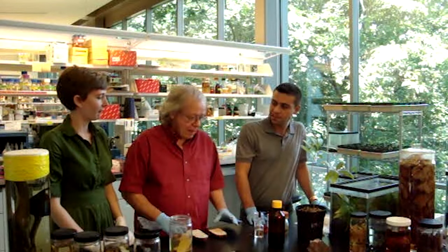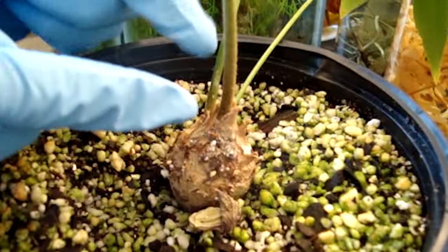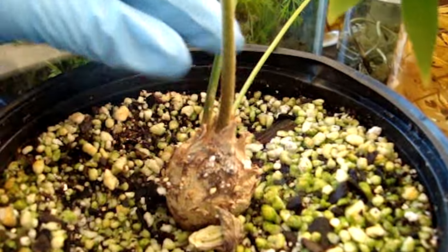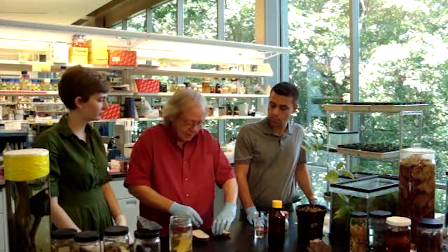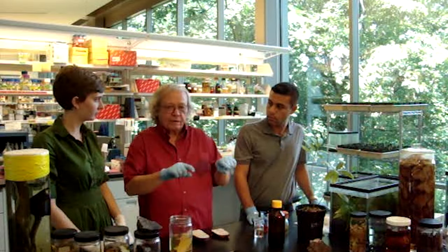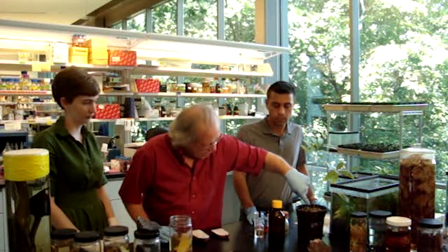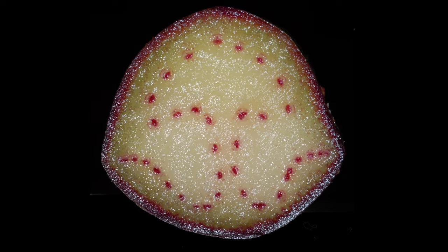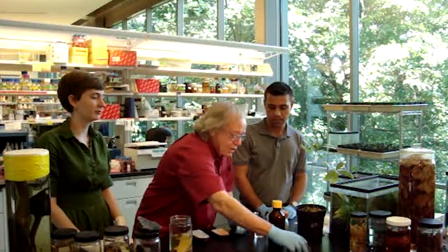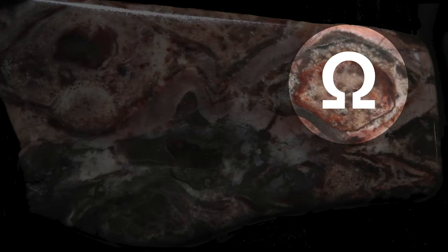Going along in the same vein about the fossils, there are other things we can do. For example, where the leaf attaches to the stem — this is called a petiole — we can use the same technique on one of those petioles. We just make a cross-section and look at the distribution of the veins. Interestingly enough, these cycads have the veins arranged in the pattern of the Greek letter omega. The really cool thing about that is when you get into some fossils, you'll see the omega pattern expressed — so again, you have another way to know that you have a fossil cycad and when that occurred in the fossil record.